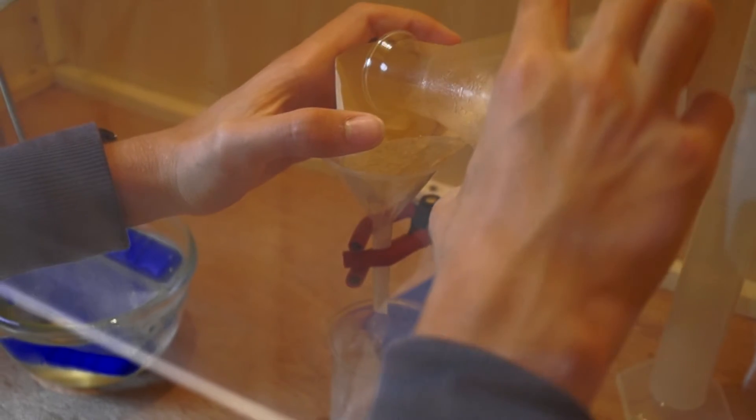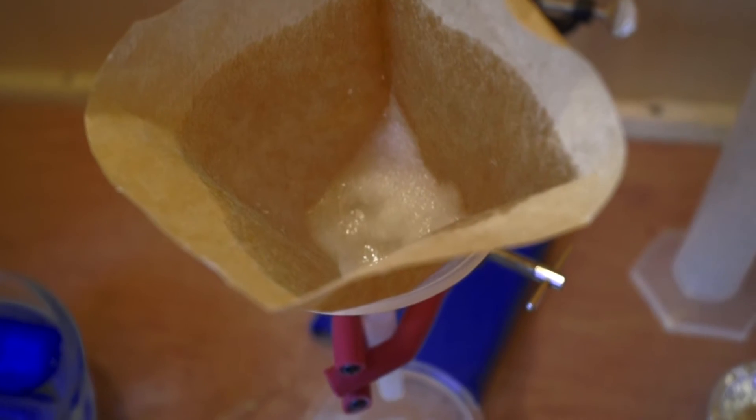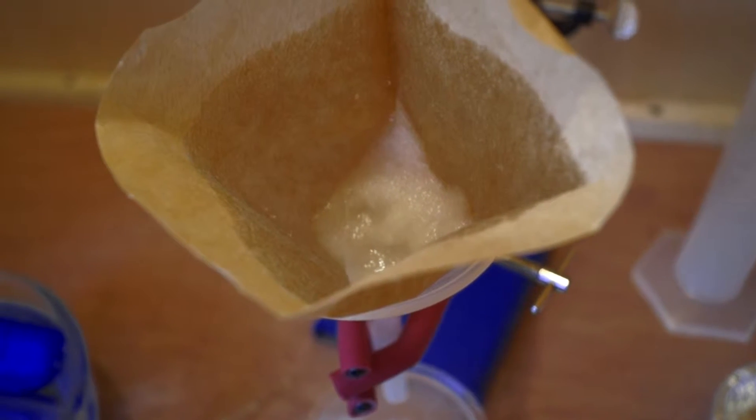After crystallization is complete you can filter the excess solvent to leave the solute behind. You are left with sodium acetate trihydrate.